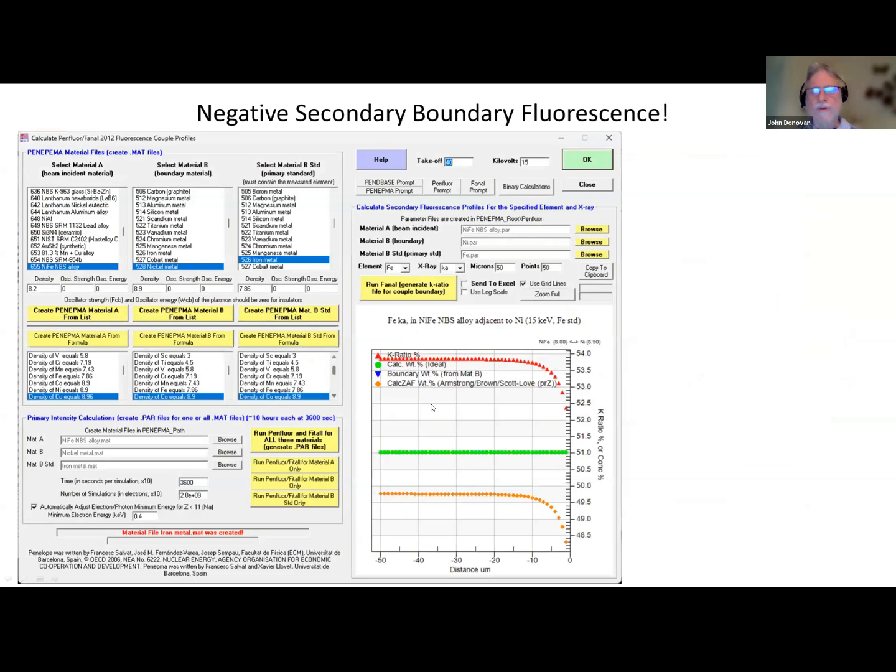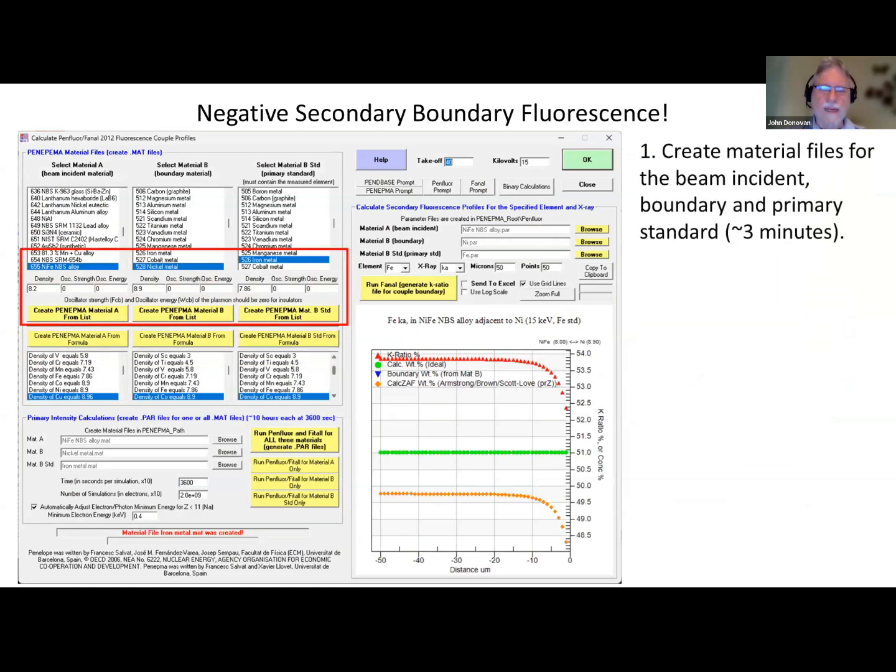You can also get a negative boundary fluorescence artifact. In this case, we've got a nickel-iron alloy. This is a NIST alloy. We're measuring iron K alpha in this nickel-iron alloy, adjacent to pure nickel. That's our boundary phase. As we approach the boundary right here, you can see that our intensities actually decrease. That's interesting, isn't it? In fact, it's about a 1.5% drop.